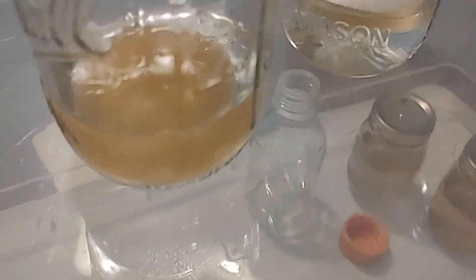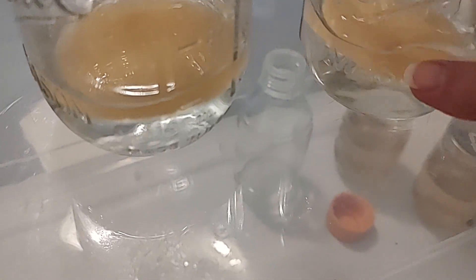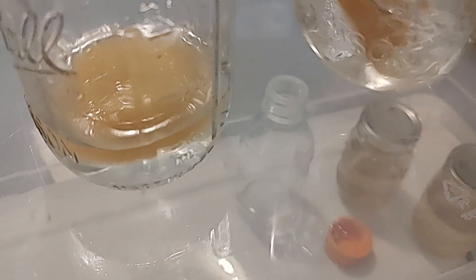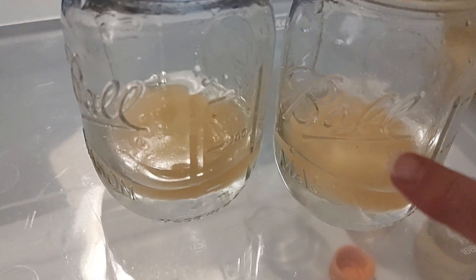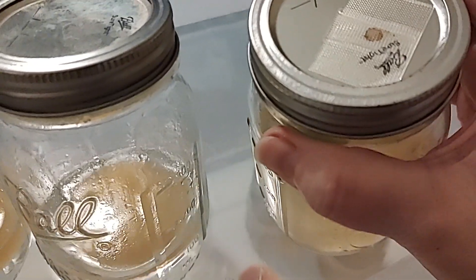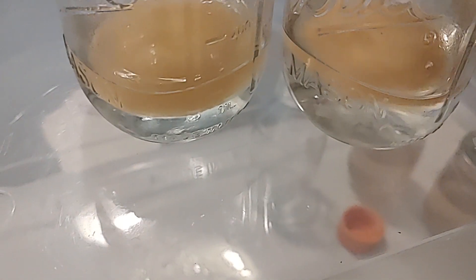So when there's a modded top and you're stirring it, it was coming out and it wasn't good. I think while we're stirring it, it's good to not have the modded top. Our plan is for it to break up with the 100 milliliters, and then we're going to add more water and put our modded tops on them. This one — if you saw the video before — was too thick. This agar was way too thick. These are thinner.